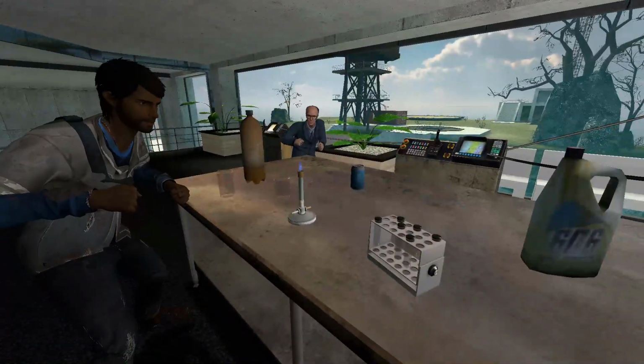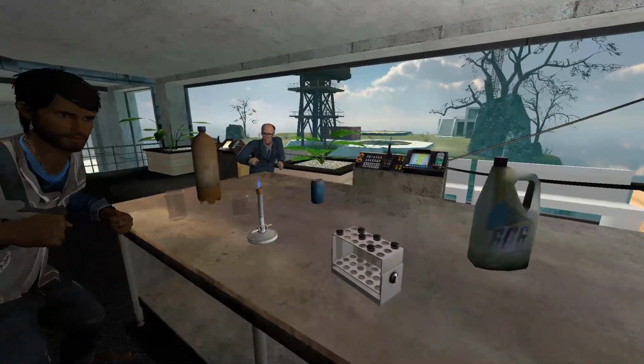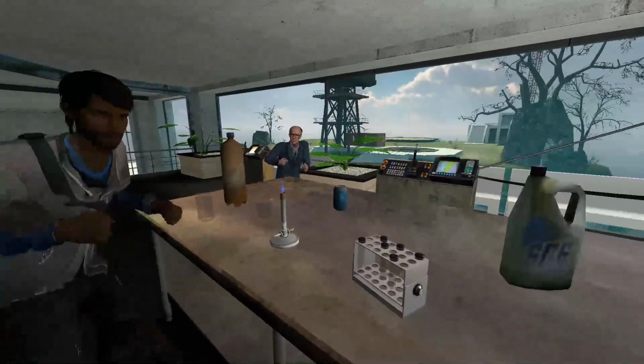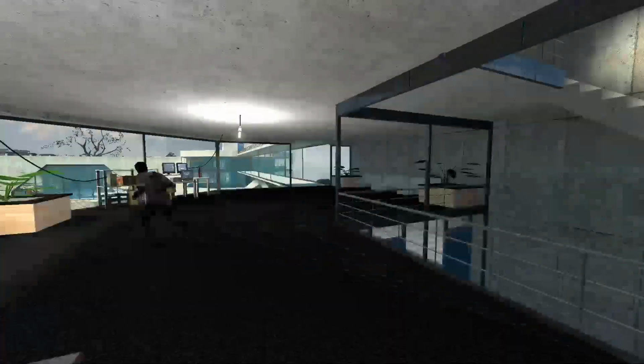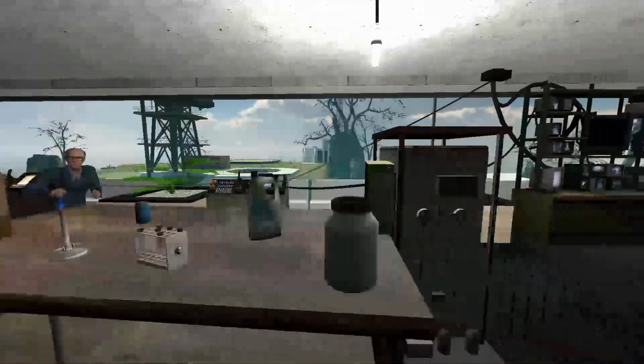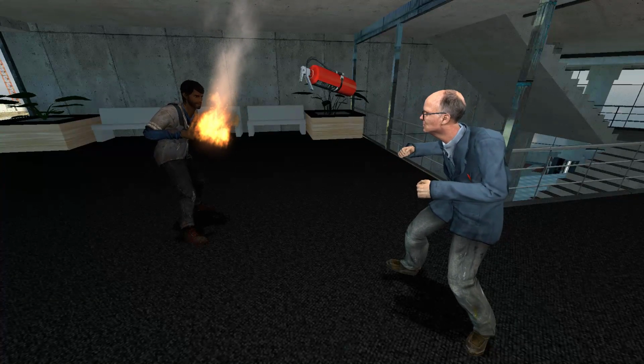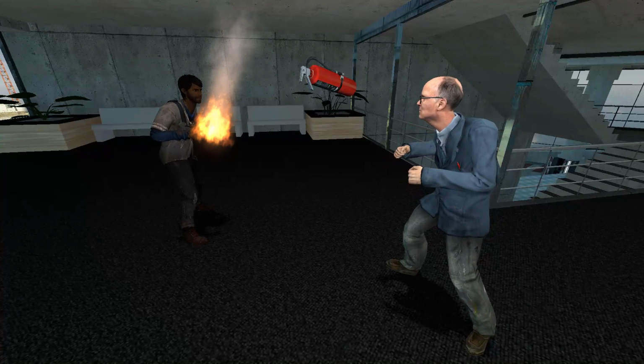Yeah, we're currently working on a confidential experiment, and I'm gonna need you to grab that soda can over there. Alright. Here you go. So just like... Ow! Dude, my hand! Ow, I can't... Oh my god. Get the fire extinguisher. Ah! Gabe, we need to help you. We need to stop the fireball.